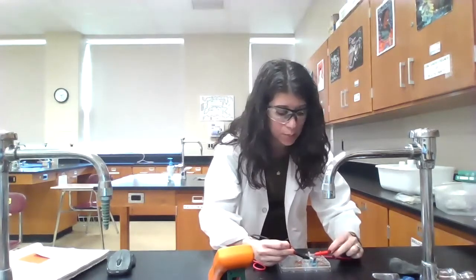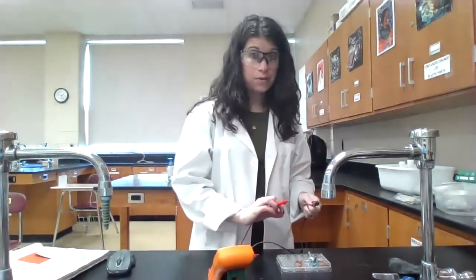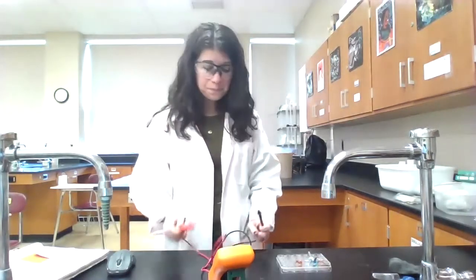So it did drop a tiny little bit, but the sign changed because I've changed which one is the anode, which one is the cathode. Now, again, I want to figure out which one of these is the anode and the cathode. And I know that if it's positive, that means zinc is the anode. So when I touch the red one to copper, the black one to the zinc, I get a positive value. So what that tells me is that whatever metal I use to touch with the black wire, that is my anode. And then whatever one I touch the red wire to, that's my cathode.